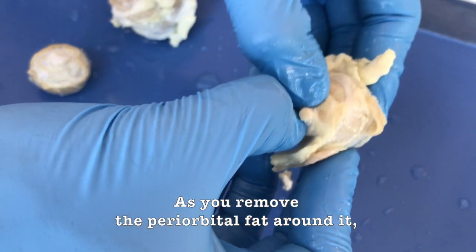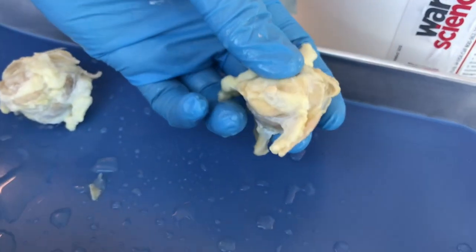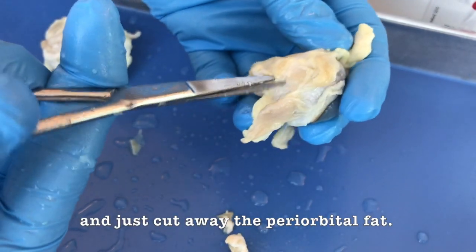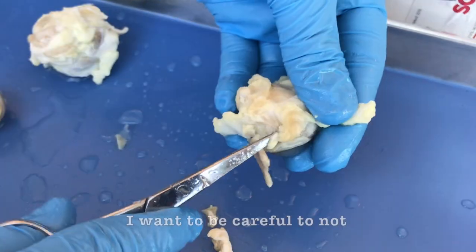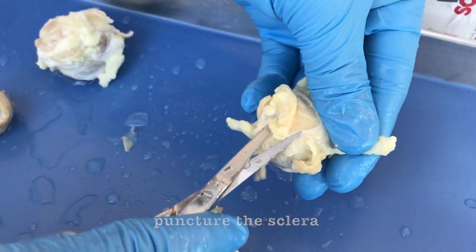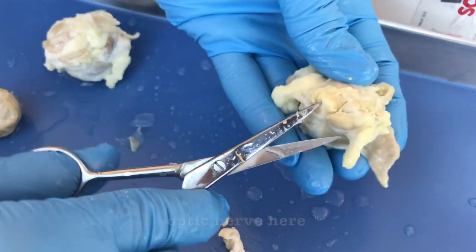As you remove the periorbital fat around it, you can see it a lot clearer. I'm going to use my pair of scissors and just cut away this periorbital fat. I want to be careful to not puncture the sclera, but I'm just cutting around the optic nerve here.